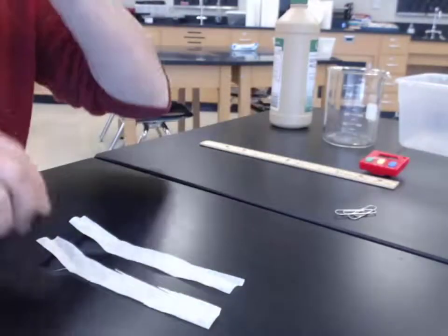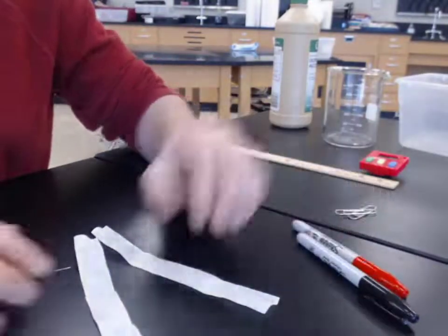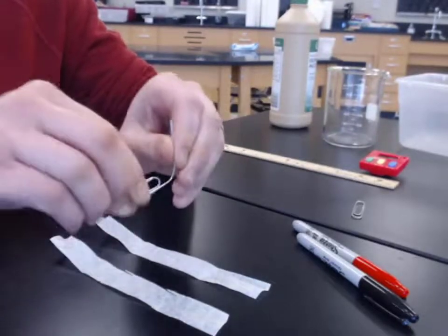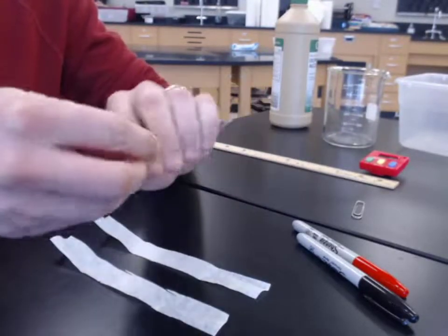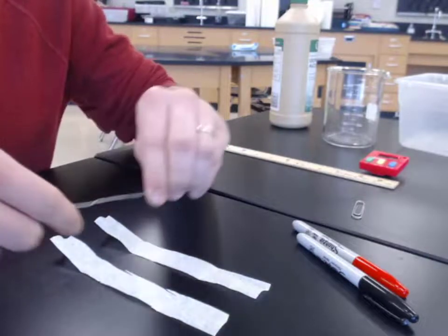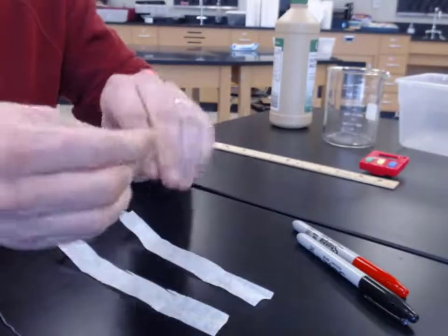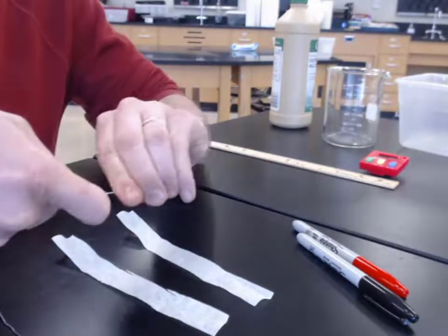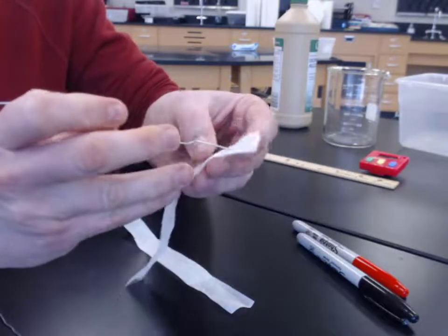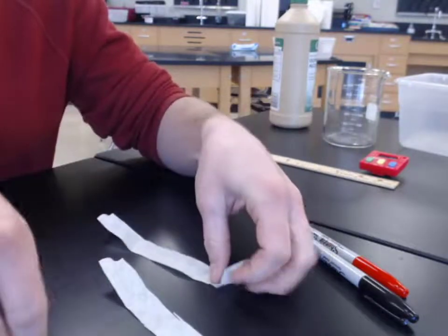All right, so now that I have my 2 strips of paper, I have my mixtures here, my inks, I need to unbend my paper clips, and then we'll cut our filter paper down to size to fit properly in our beaker. So let's get a couple of these unfolded. There we go. And then I'm just going to poke it through, not the very top, because we don't want it to break, something like that. And we'll trim off the bottom.